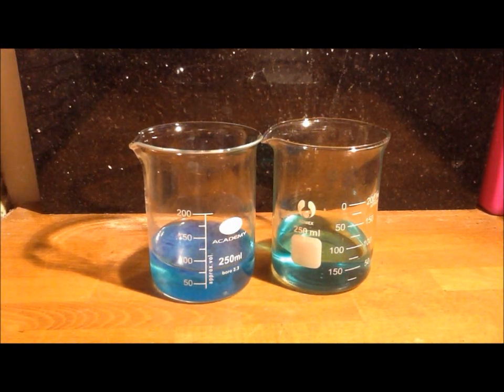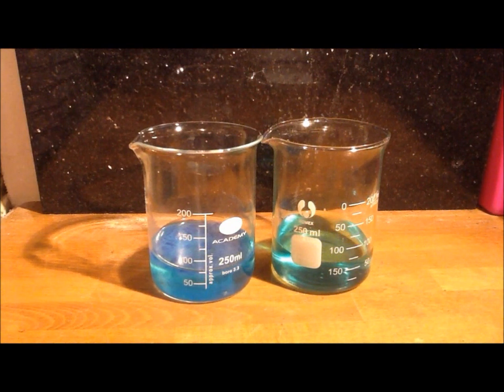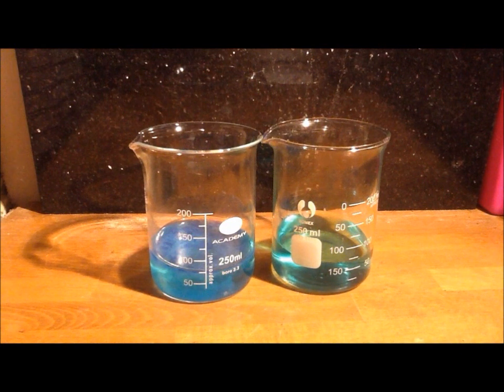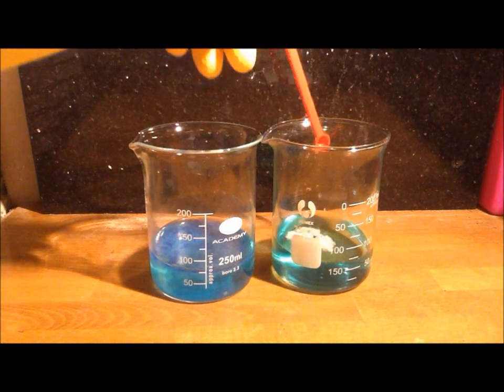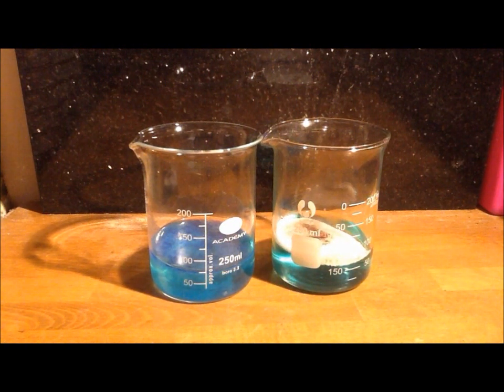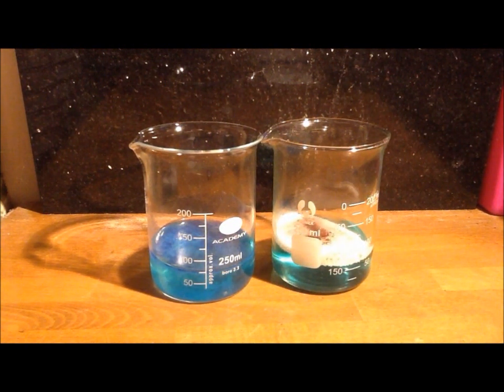So to confirm this, you need to get your potassium permanganate and add a very small amount to your bleach. And there you can see a quite clear reaction taking place.